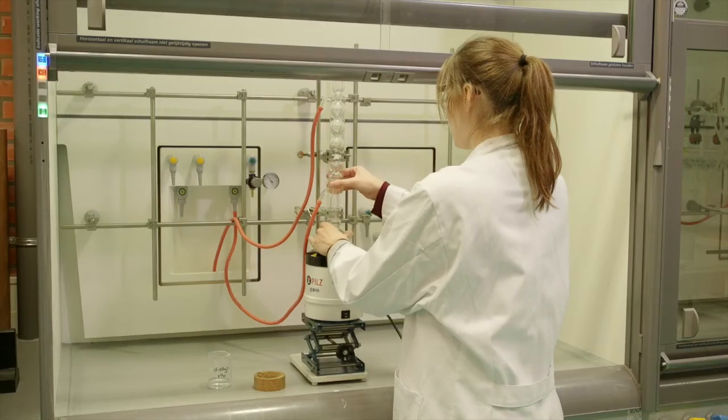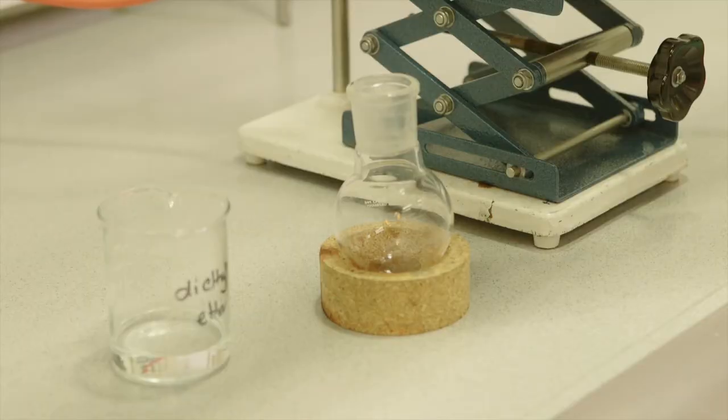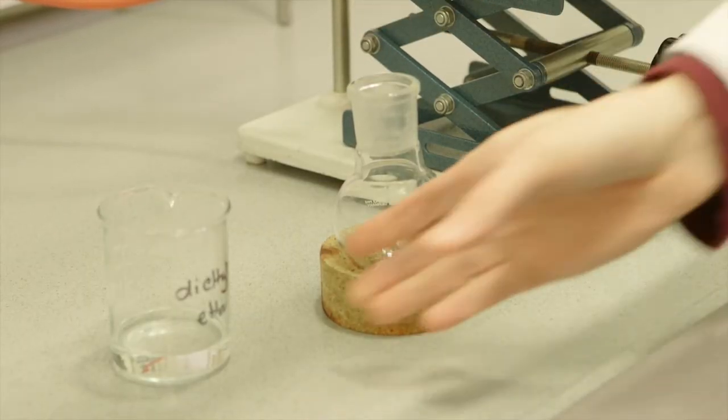Remove the flask from the setup and fill with the desired solution. Add boiling chips or a stirring rod to prevent flash boiling.